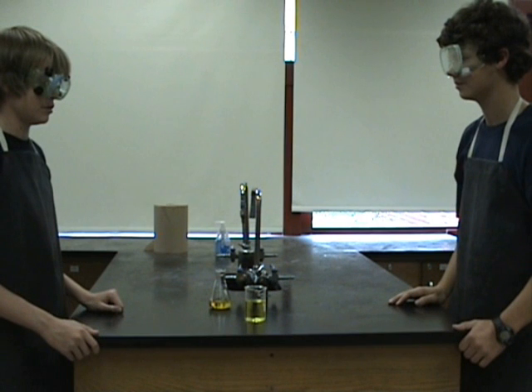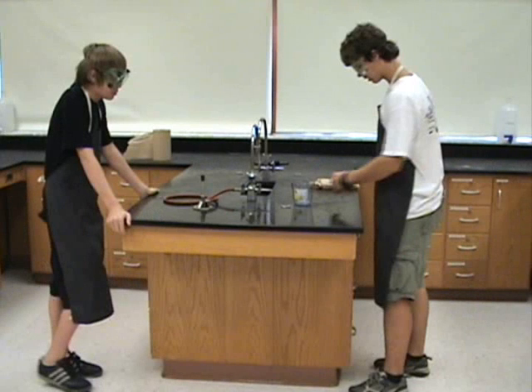These two students have followed all safety rules and are alive and healthy. Observe as the carelessness of these two students causes a massive explosion in the school.